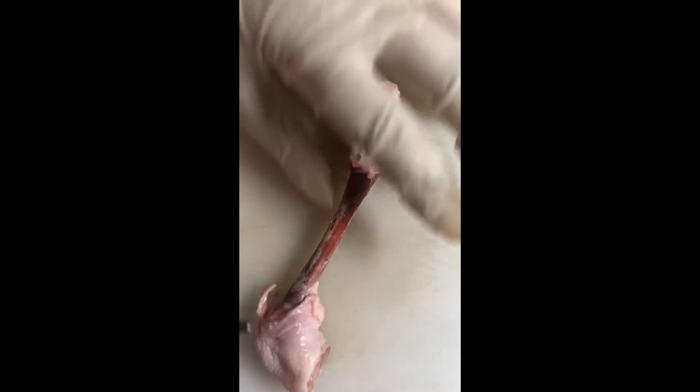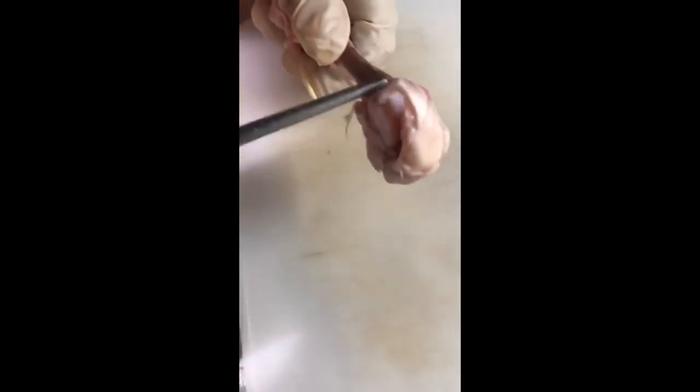At the end of this bone you will see cartilage. It protects your bones and keeps them from touching constantly and wearing down. You can also break apart the hinge joint — as we look more closely we will see cartilage between the femur and tibia.